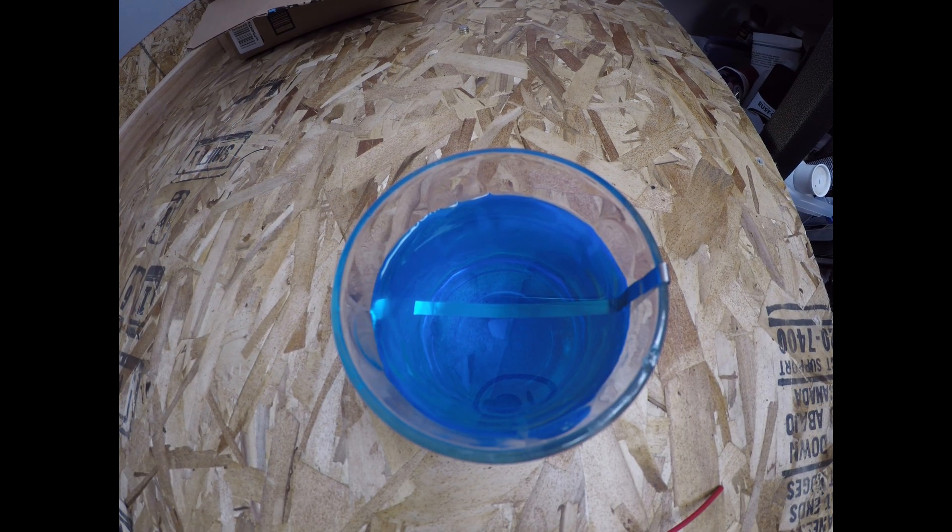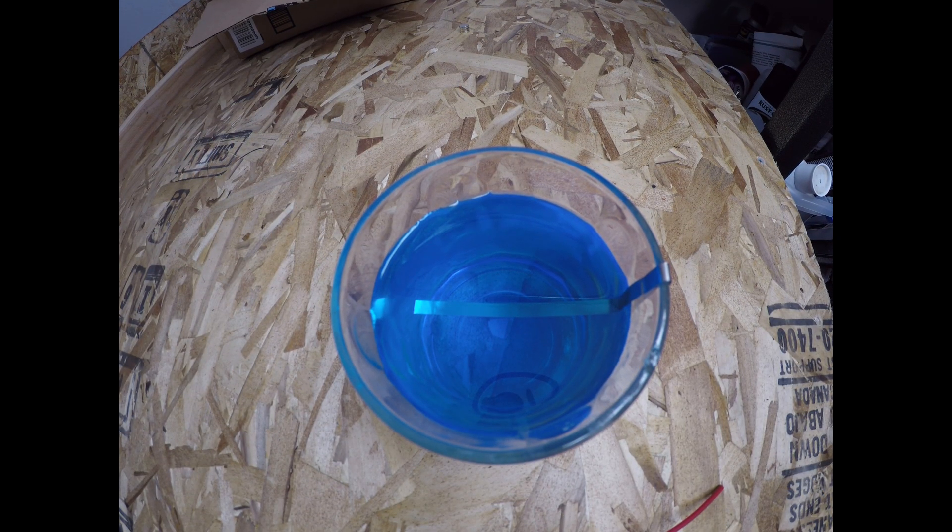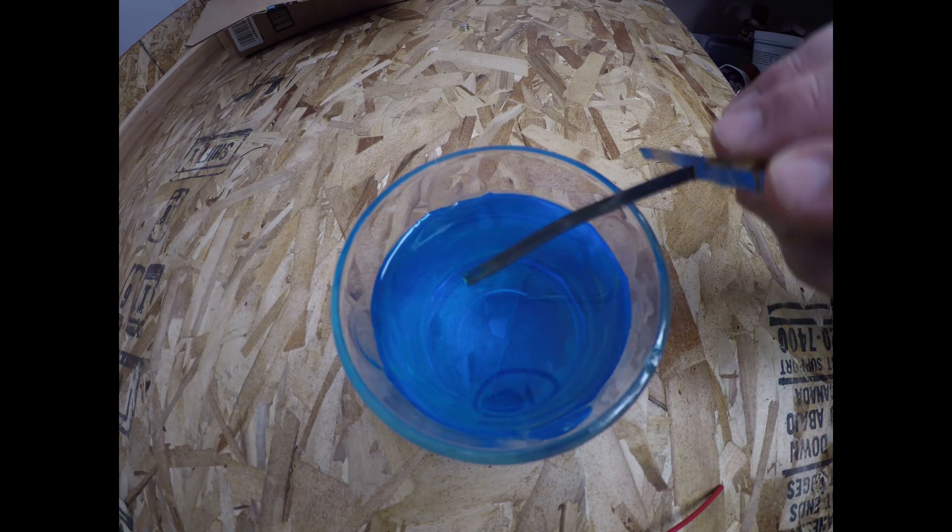Here is a strip of nickel left in a copper sulfate solution for over two days. There is absolutely no reaction.